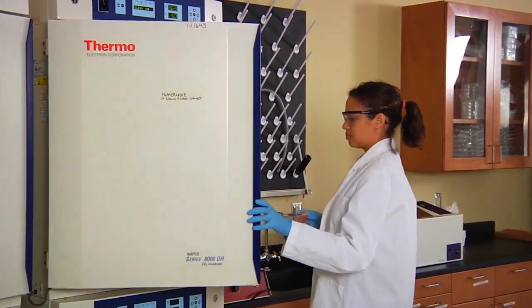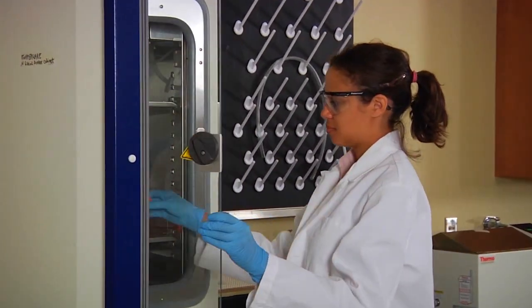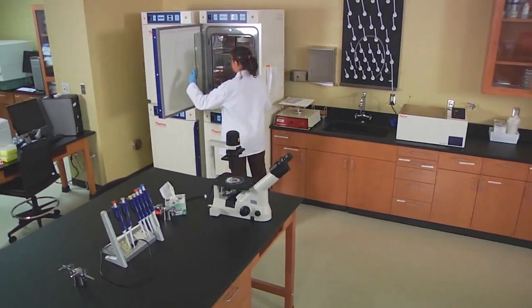Incubate the culture at 37 degrees Celsius. Now the cells are able to continue growing and dividing.